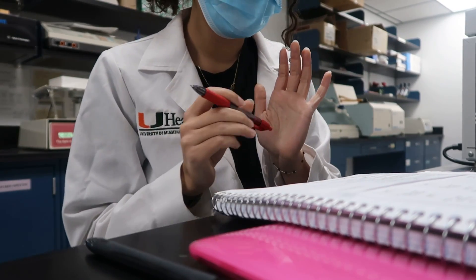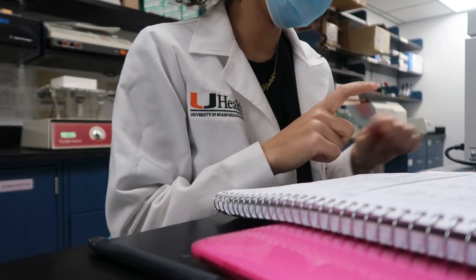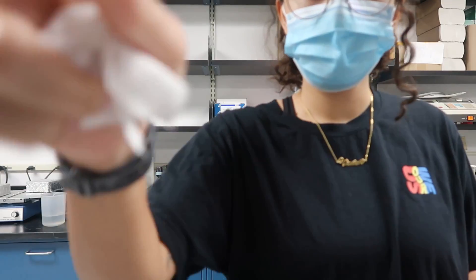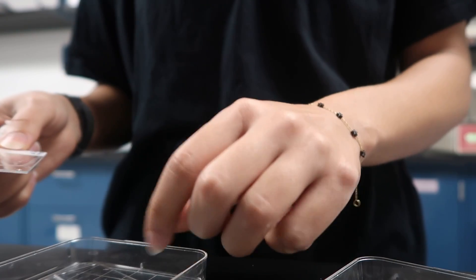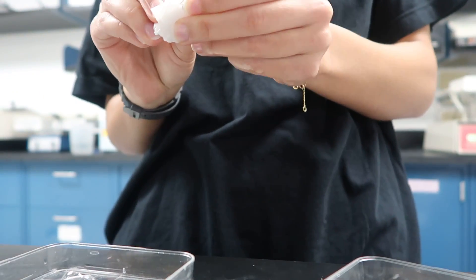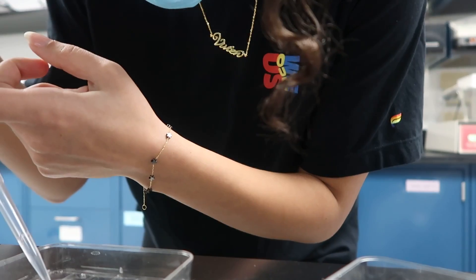So in five minutes I will stop the wash and add 10% normal donkey serum. We're having the same drama — let's move it down here so you see the action. Drying off my slides so my hydrophobic borders mean something. Where's the paper towels? Got him! Ha! Got him! If you don't know that meme, it's okay, you will.